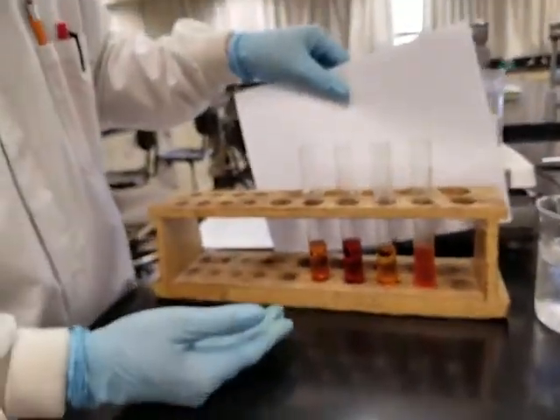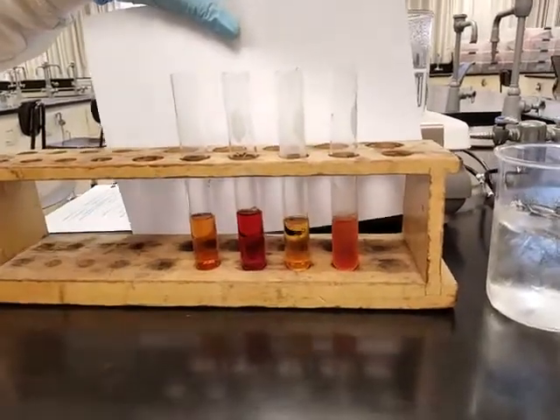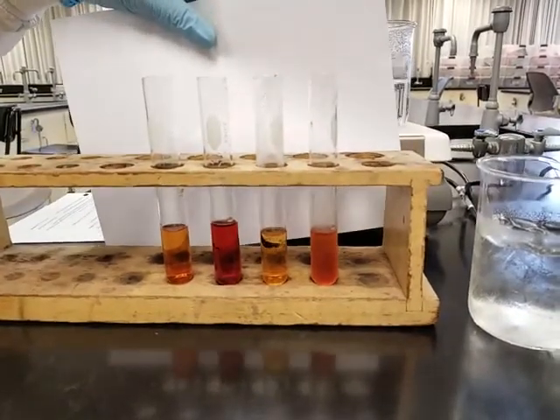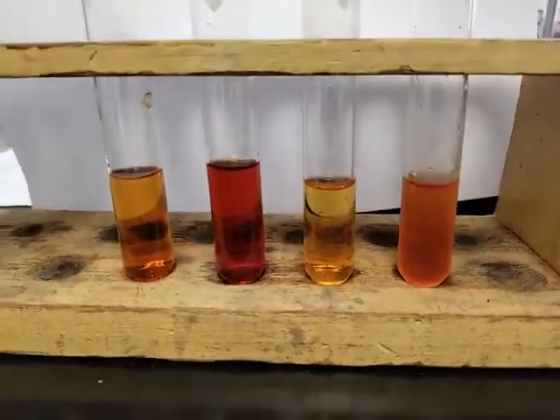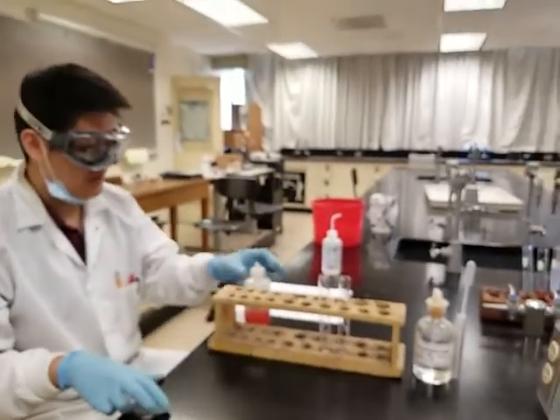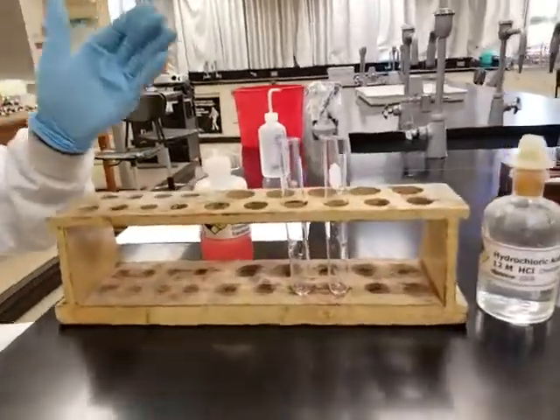So what do you say? What do you think? What do you think happened? And write your observations down and see how heat, or the absence of heat, cooling it down, might play a role in shifting the equilibrium towards the left or right. Alright, that is part B. Alright, now we're going into part C. I know part B was a little bit wacky, but that's just how it is. We'll just stick with the data we have collected and move into part C.